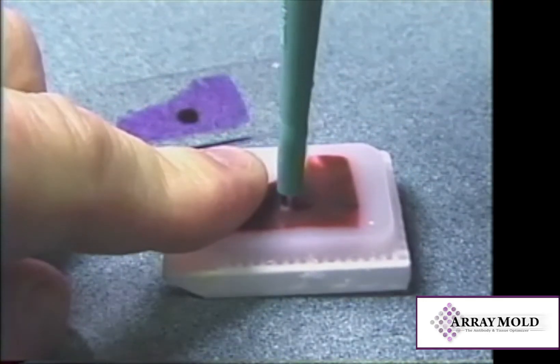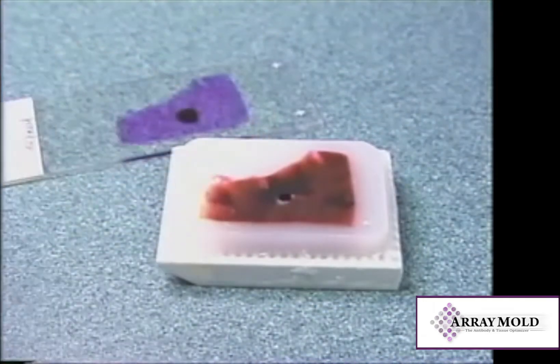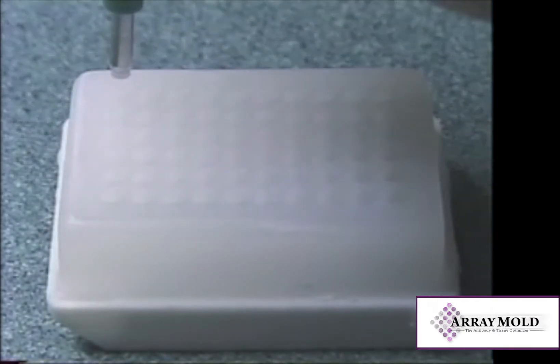If DNA or RNA testing is required, these needles are relatively inexpensive and can be disposed of after each single punch.